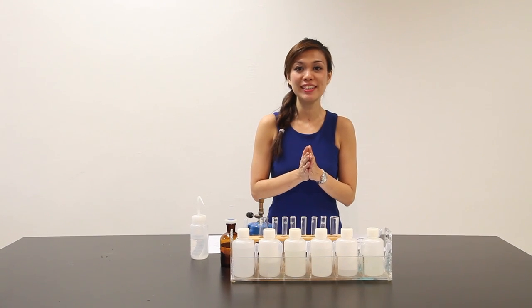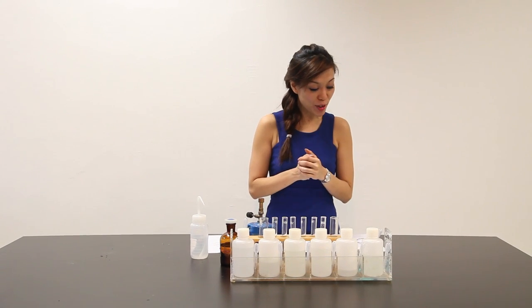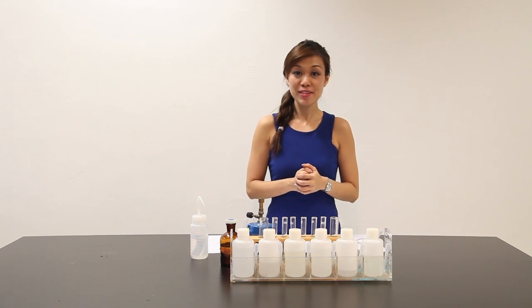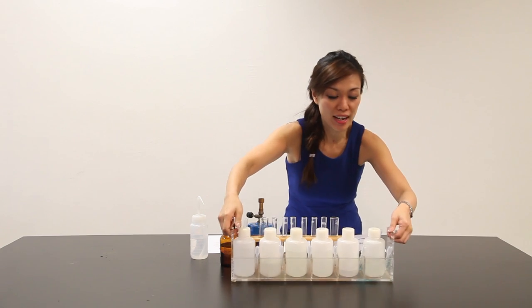Welcome to another episode of Practical with Ms. Selina. Today we are going to do 2009 GCE O Level Practical. So are you ready? Let's start the preparation. Let's remove the clutter.